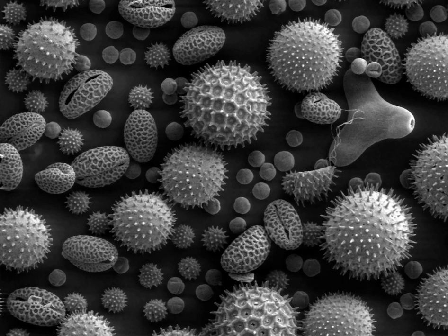Electron microscopes do not naturally produce color images, as an SEM produces a single value per pixel. This value corresponds to the number of electrons received by the detector during a small period of time of the scanning when the beam is targeted to the pixel position. This single number is usually represented, for each pixel, by a gray level, forming a black and white image. However, several ways have been used to get color electron microscopy images.